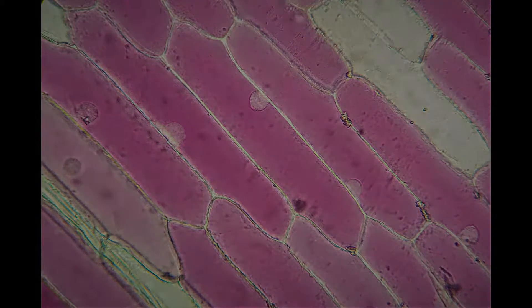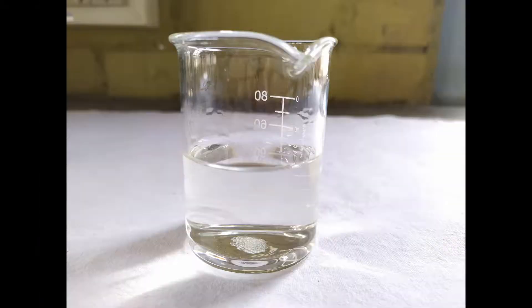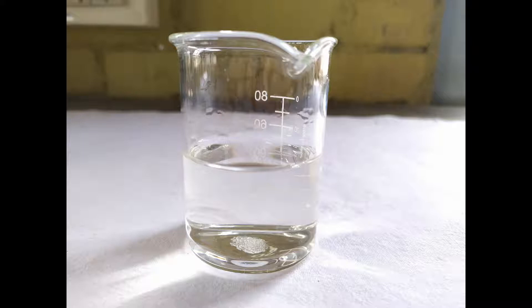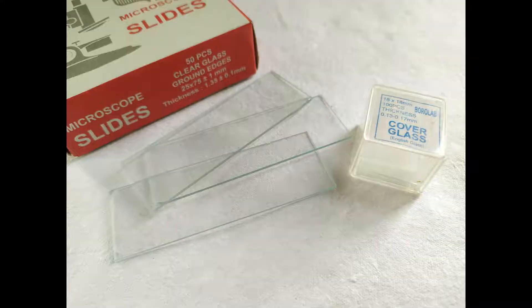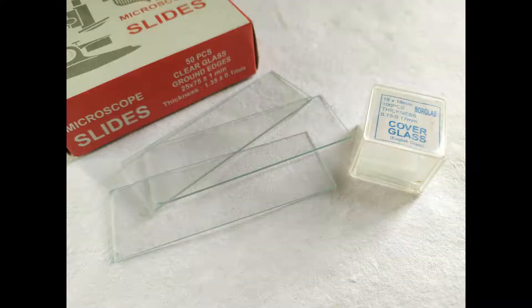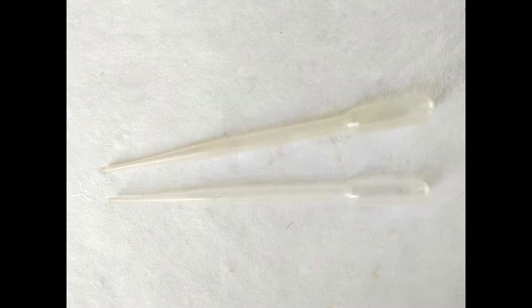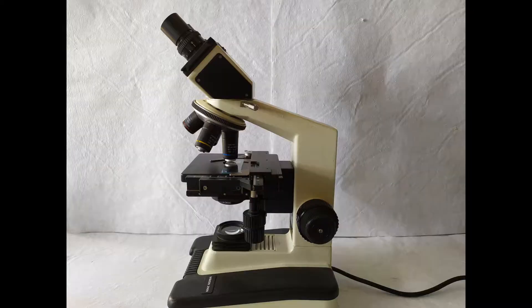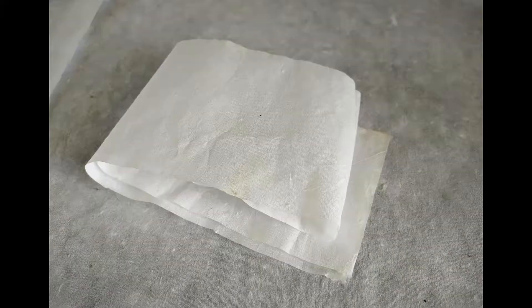For this experiment, we'll need the following: an onion bulb, concentrated sucrose solution or 10% sodium chloride solution, glass slides and cover slips, pins and tweezers, droppers, distilled water, a compound light microscope, and filter papers.